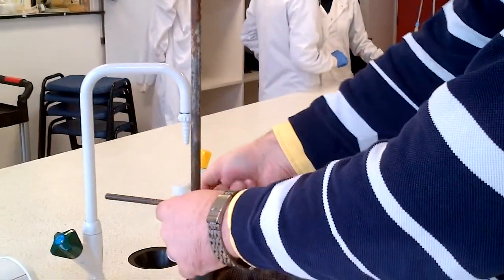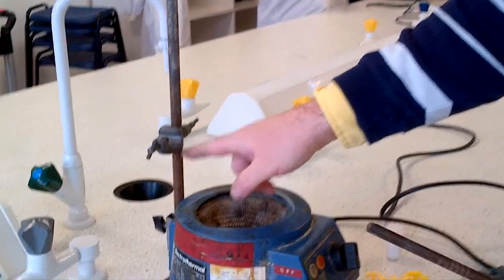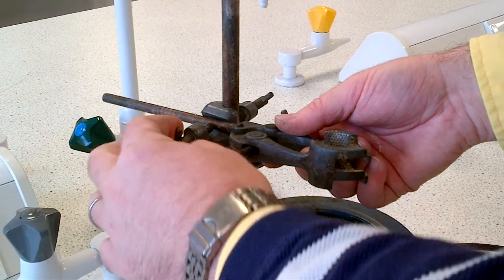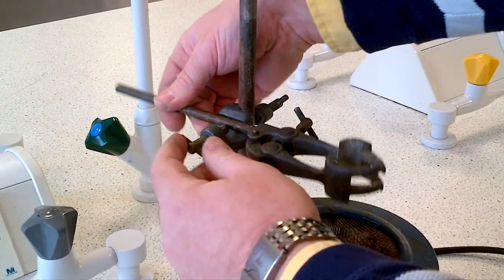Connect the boss and clamp as follows. Make sure the ridge of the boss is positioned so you can thread the clamp in and tighten. If you need to take anything out, you can just unscrew and lift out.